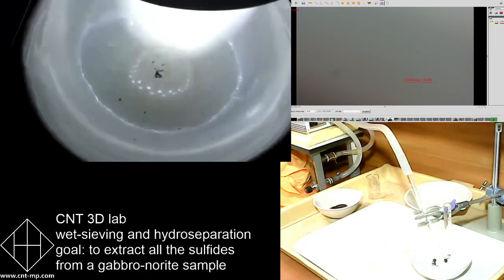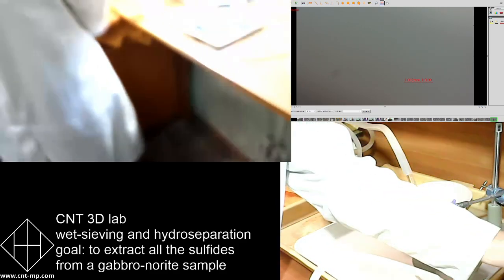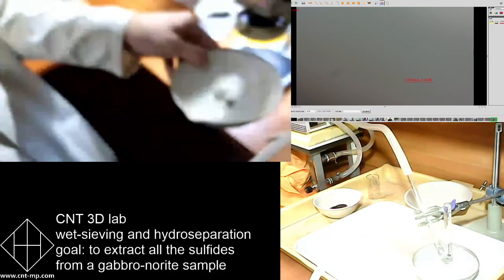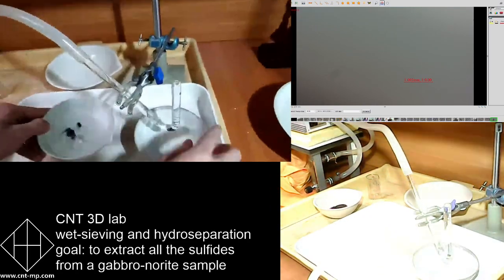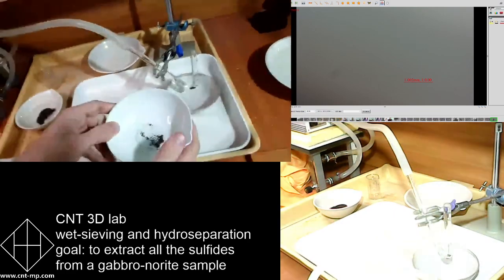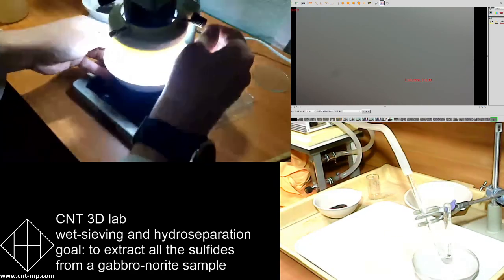Can we check? Yeah, that's the final concentrate, right? This is the final concentrate, or is it the reject of the tailings? What is it? Okay, preliminary concentrate. Okay, all right. So guys, you have to understand that hydroseparation is done in stages.